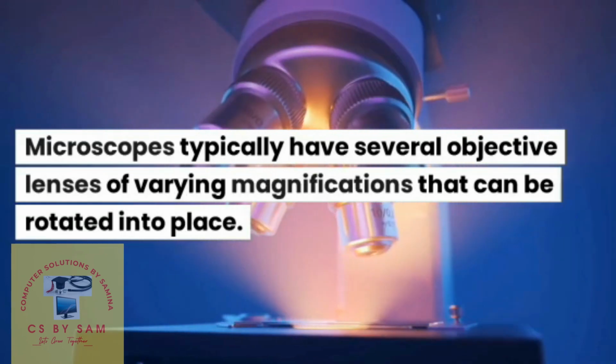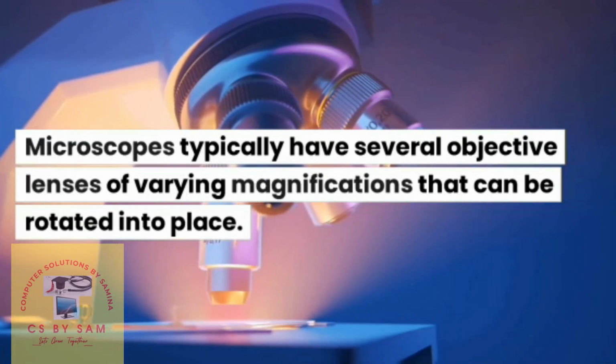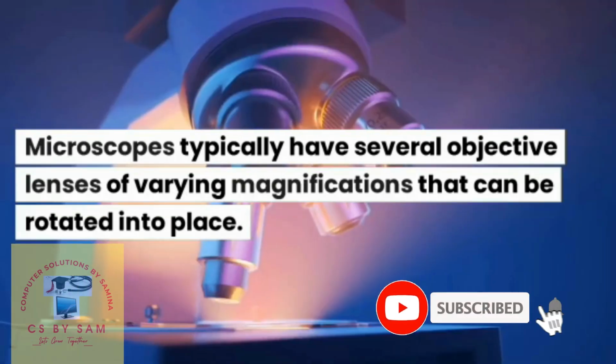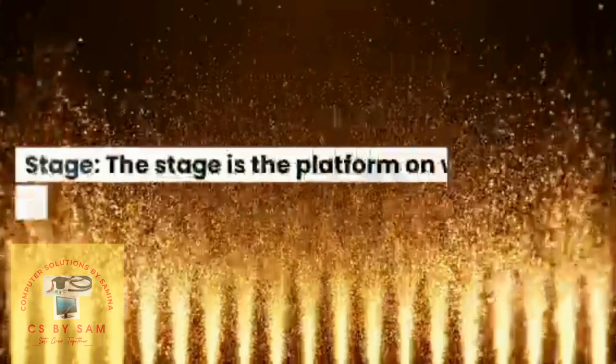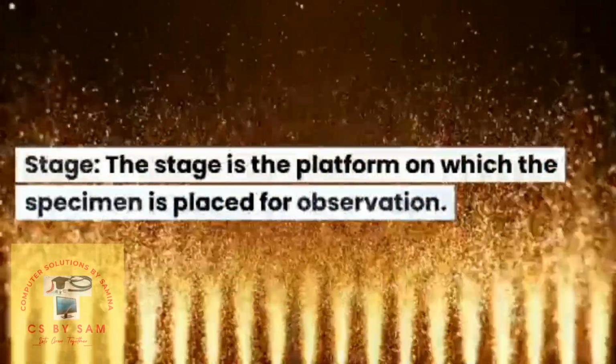Microscopes typically have several objective lenses of varying magnification that can be rotated into place. As I have already told you, they may be 10x, 20x, 40x and 100x oil immersion lens.